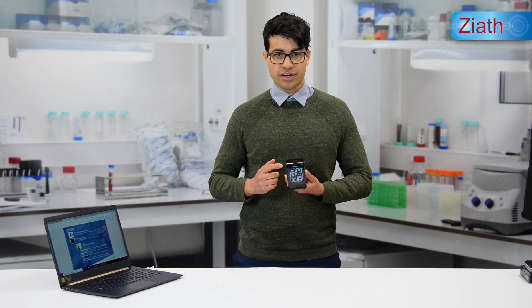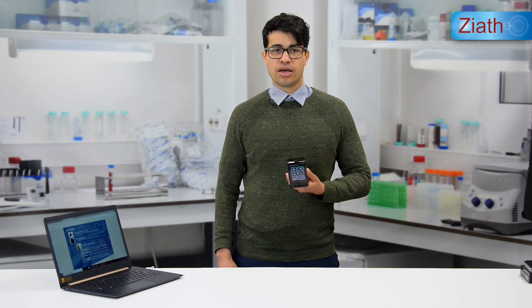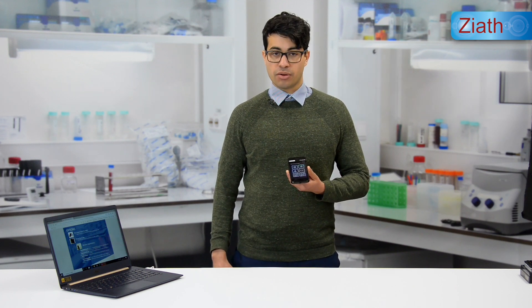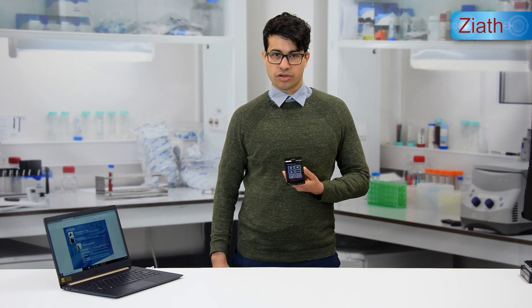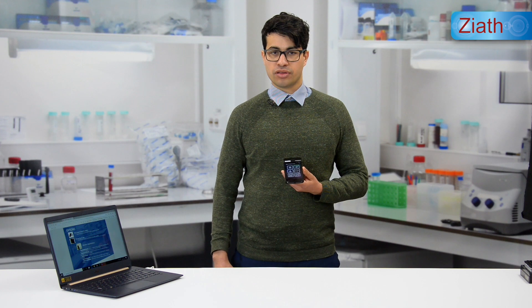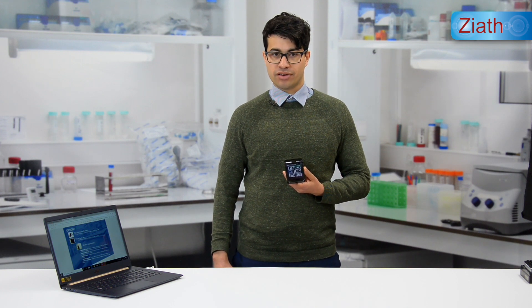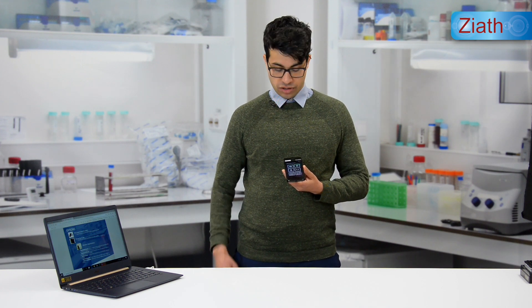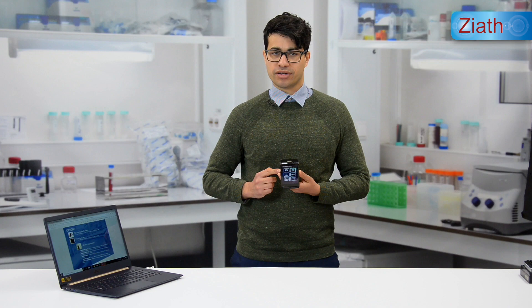The handheld device can also scan linear barcodes — that is 1D barcodes — with an extra attachment called the Opticon. They are paired via Bluetooth, and when a linear barcode is scanned with the Opticon, it will appear on the handheld device.